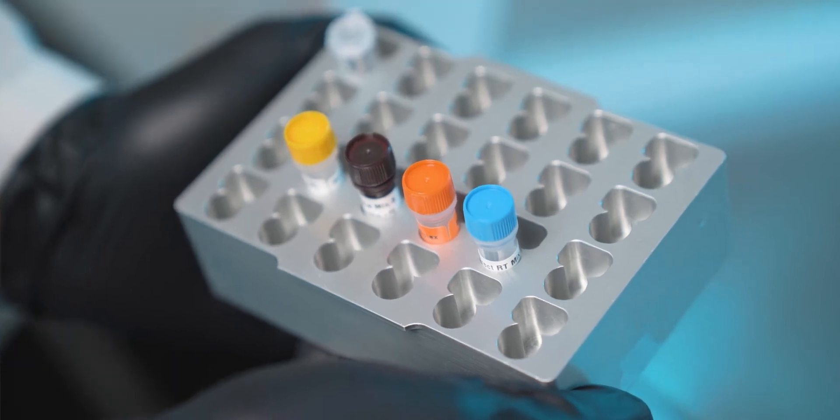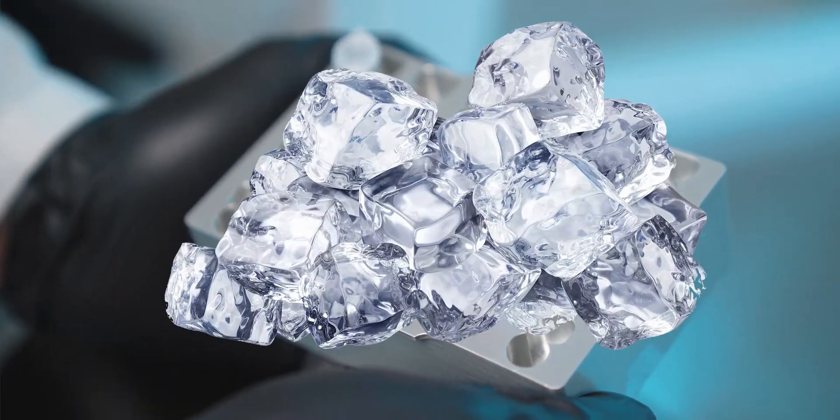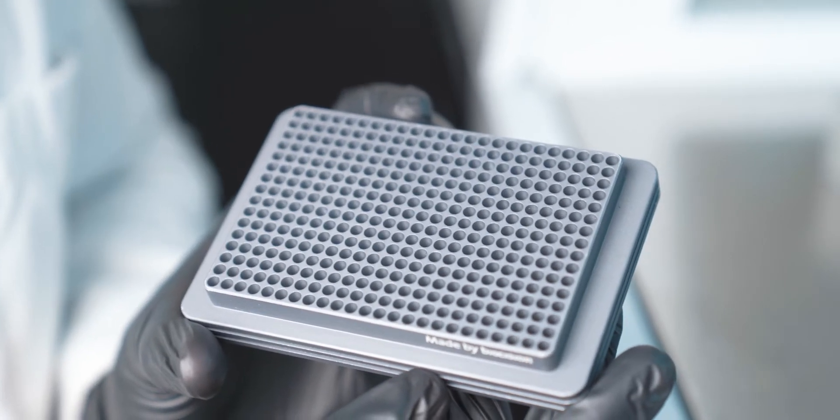Make sure to keep all ingredients on ice. Also make sure to keep your final master mix on ice. Make sure you keep your master mix plate on ice. Just keep everything on ice.